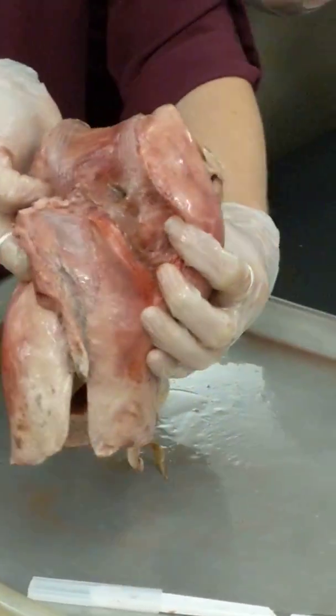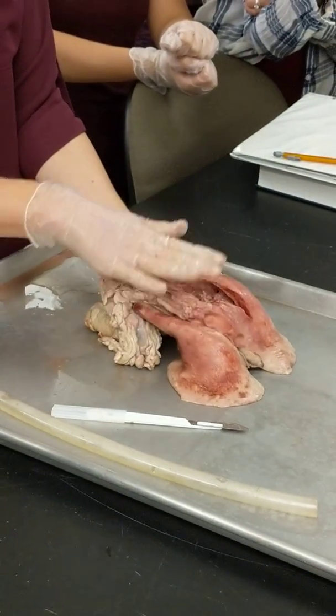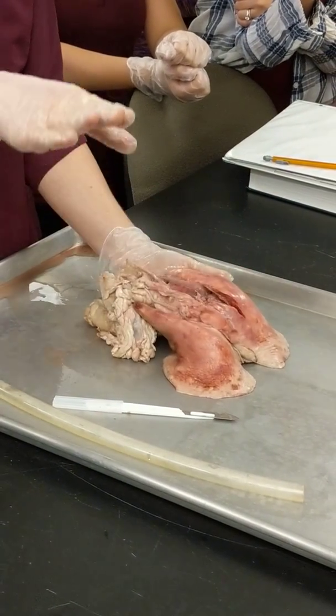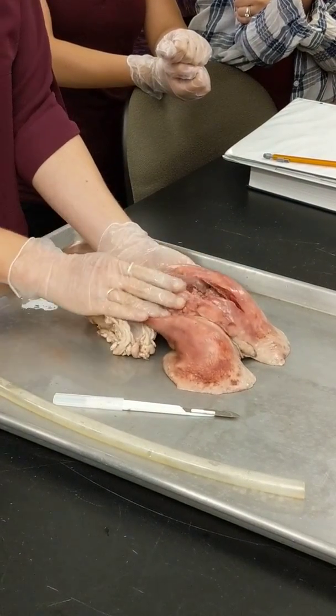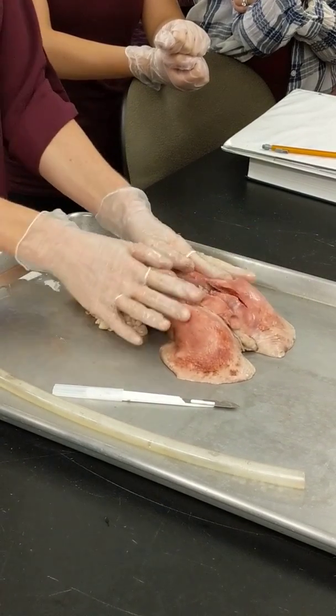Okay, all of that being said, I wanted to show you guys this because it's cool. I'm not going to have a pig pluck out there. I'm going to ask you these questions on a model where we can actually see it. And you don't have to have your face this close. Any questions about the pig pluck?